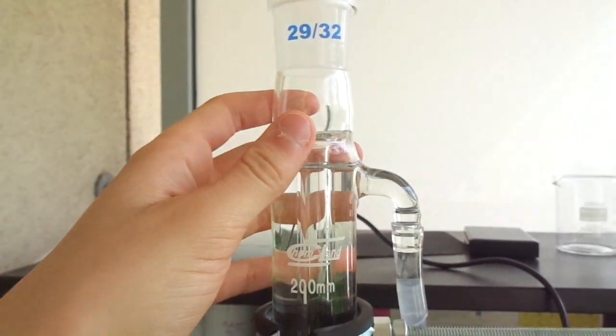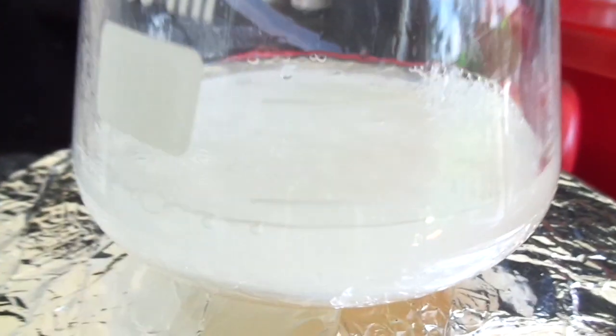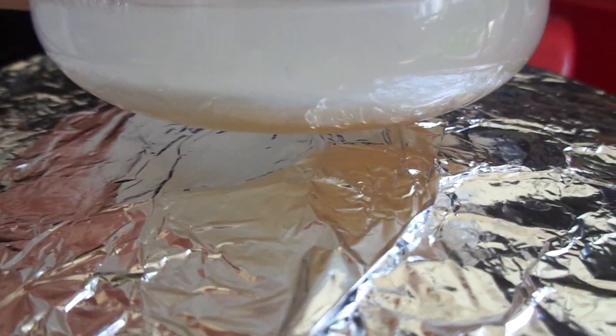So I got the reflux going, the water is flowing. As you can see we got a nice reflux, everything is boiling.